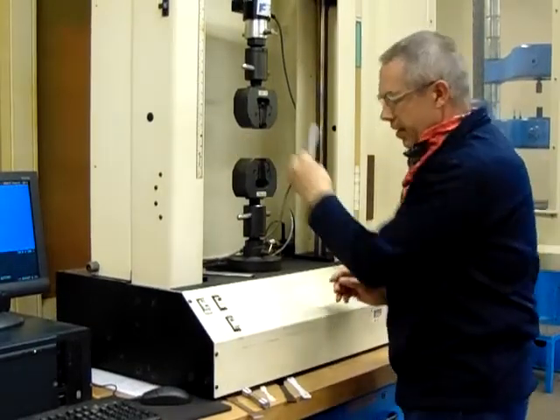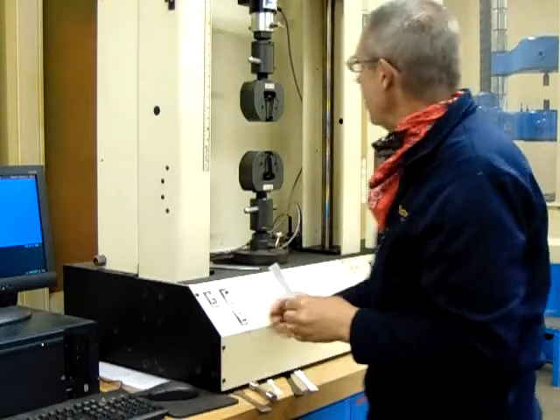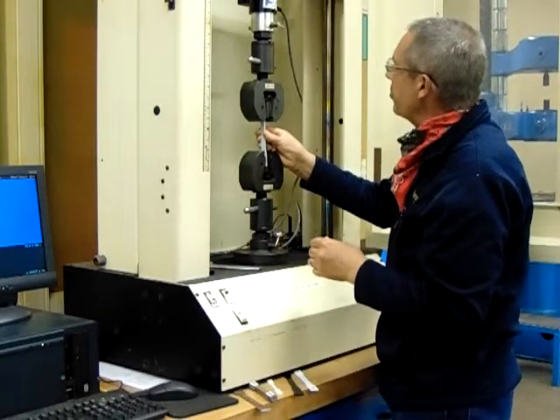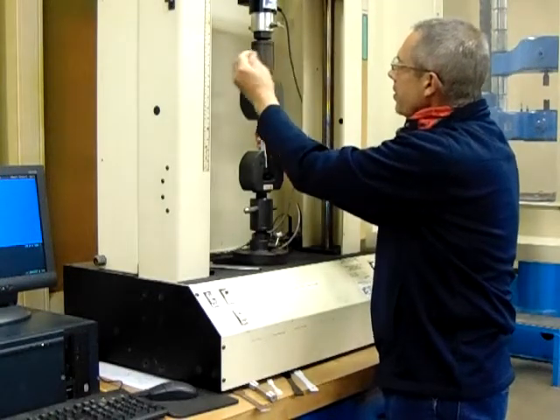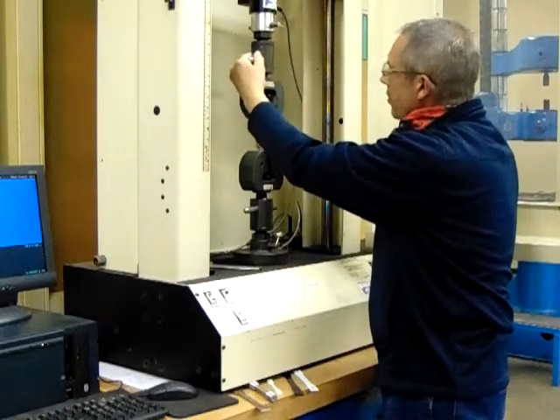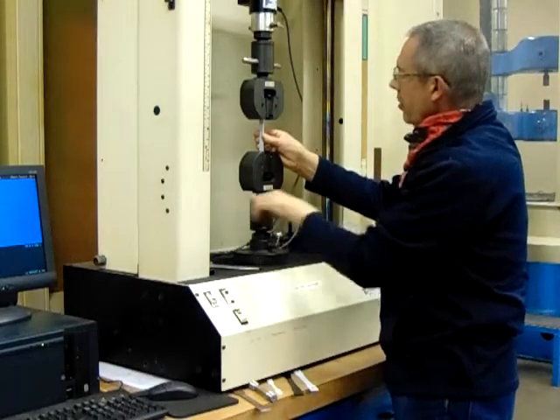That looks pretty good right there. And once we're done with that, we need to go out of the jog mode. Then we're going to load the top part of the sample first, and then we'll do the bottom one.